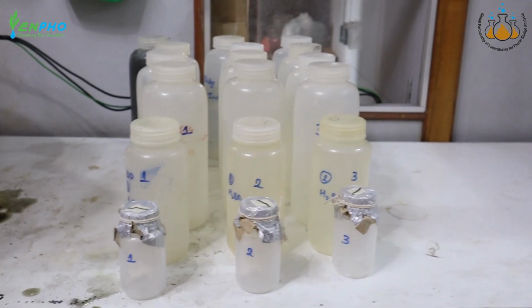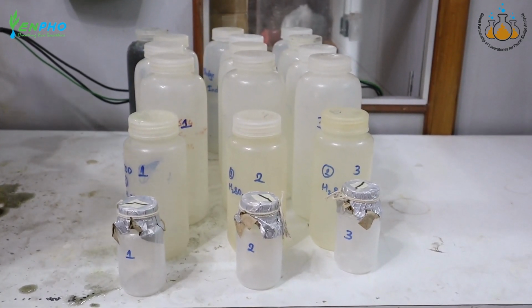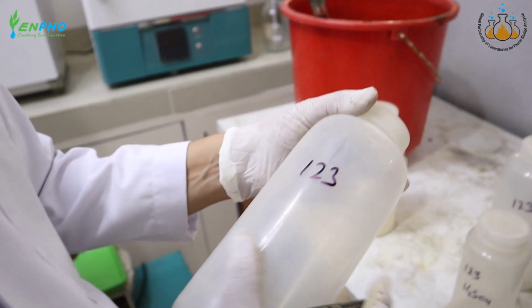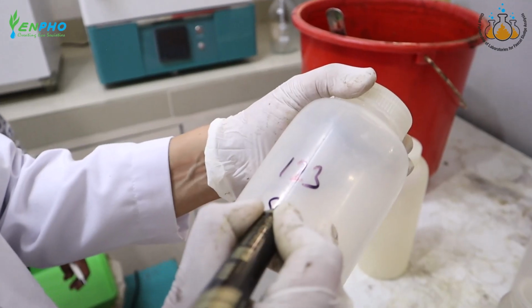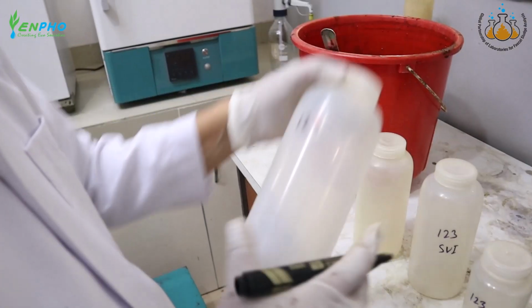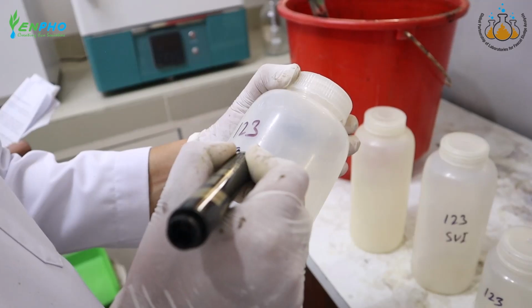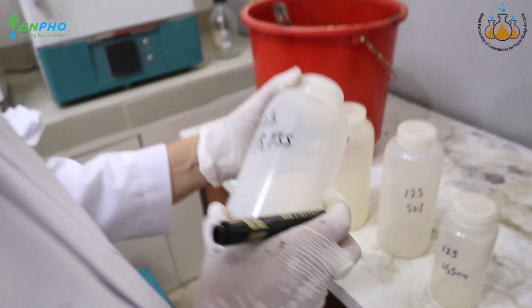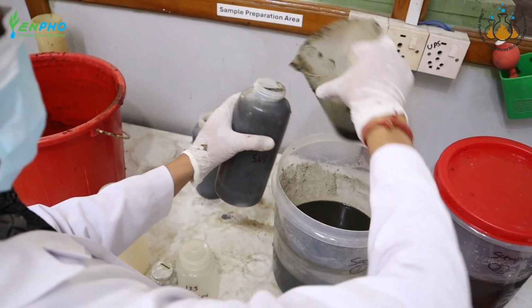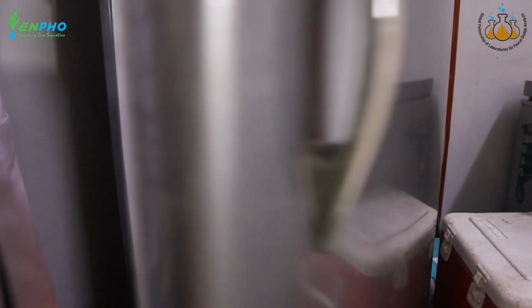For the storage of the sample, the researcher arranges different volumes of sample bottles based on the different types of analysis. For the physicochemical parameters such as total solids, pH, TSS, turbidity, EC, ammonia, sludge volume index, orthophosphate, and nitrite, the researcher stores the sample in 1-liter bottles without preservatives. pH and conductivity are analyzed immediately while the remaining parameters are tested later after refrigeration.